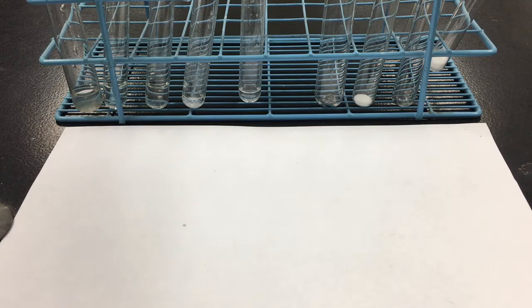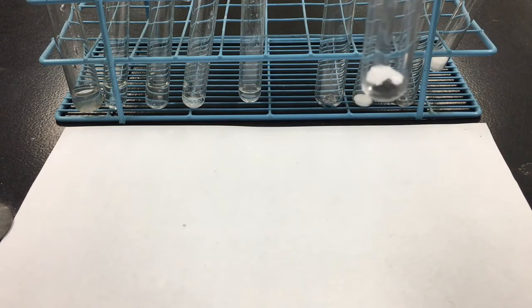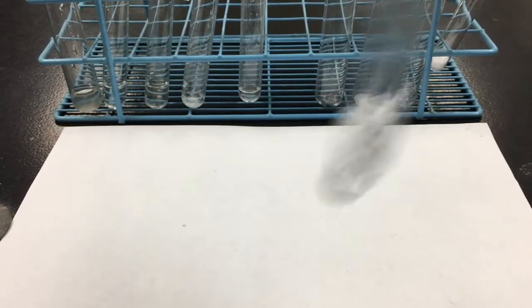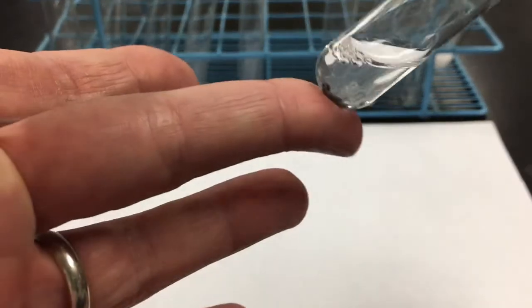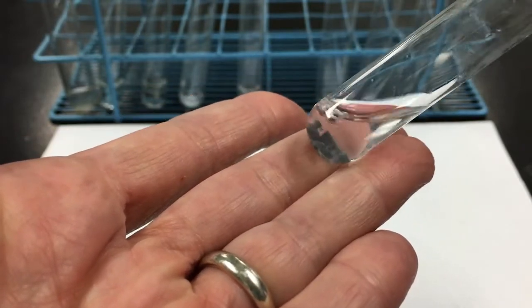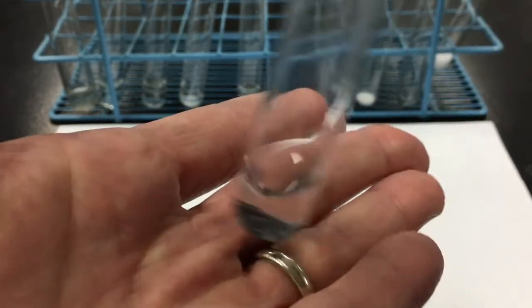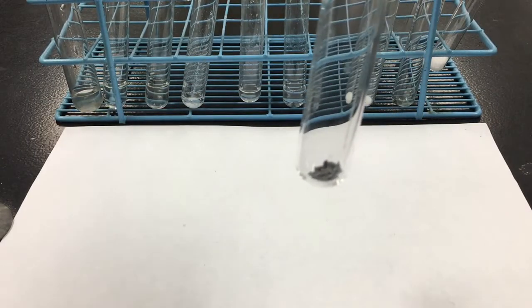Next, we have substance D, the gray pellets, with liquid 1. Shake it up a bit more. So it looks like the same amount of the gray solid that I started with. It doesn't seem to be getting smaller or disappearing or anything. And it looks like I still have a clear colorless liquid on top. No noticeable temperature change. And none of my starting substances had any smell to begin with, and I don't smell any smell now.